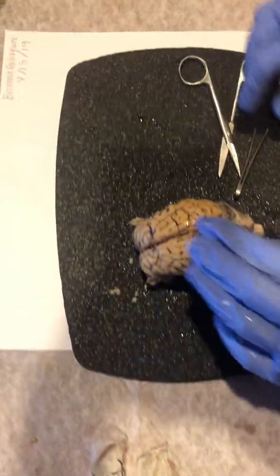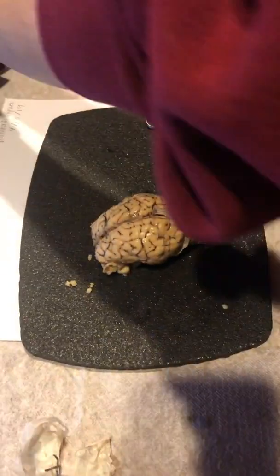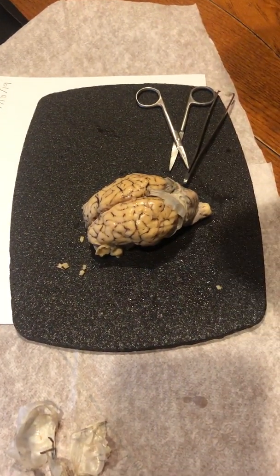Perfect. Okay, now I'm going to make an incision through the middle of the brain. So I'm going to get my scalpel here.